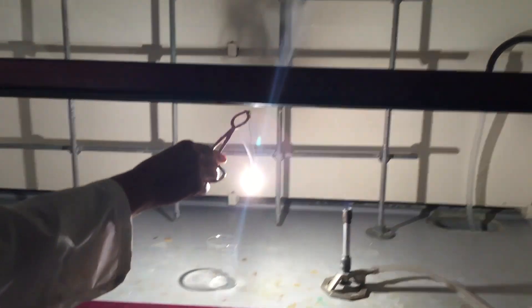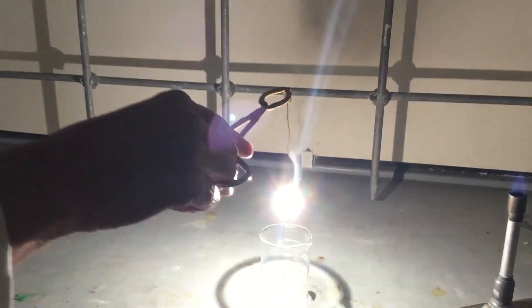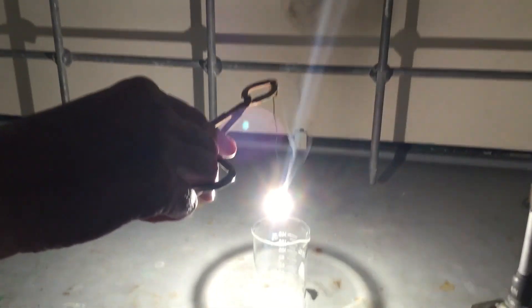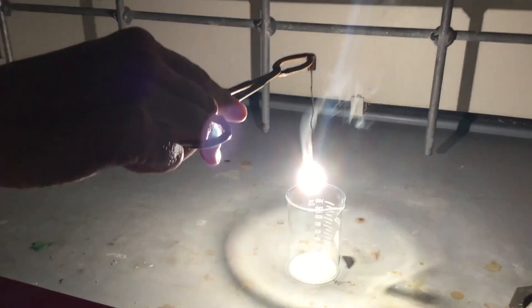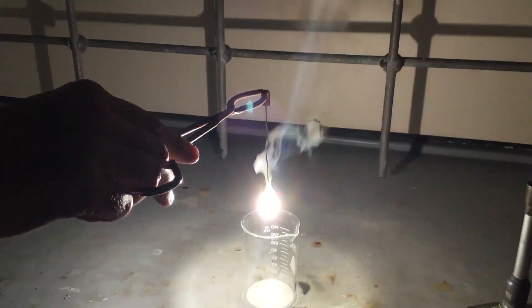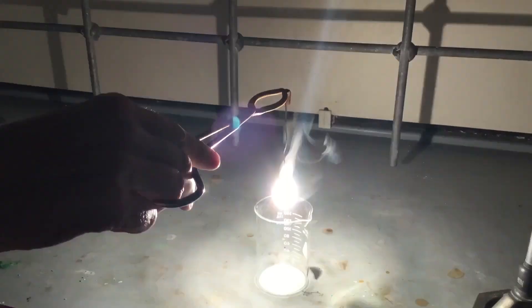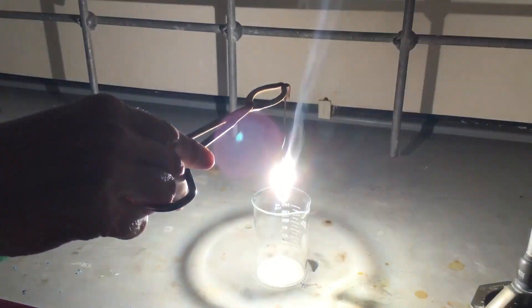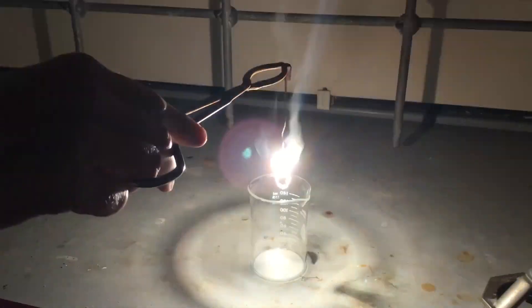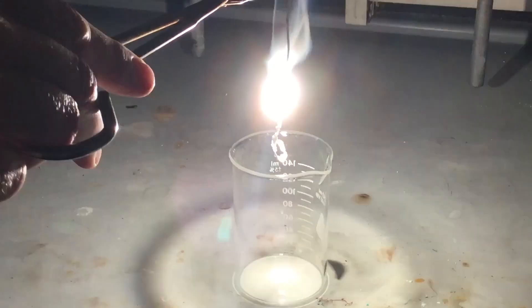Very bright light. I'm going to try and collect as much of the magnesium oxide that is getting produced in this reaction inside this beaker. You can see that the smoke is also magnesium oxide — much of that smoke contains the solid magnesium oxide that is produced by reacting magnesium with oxygen.